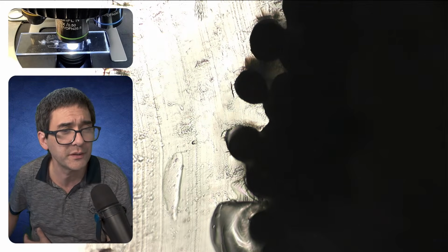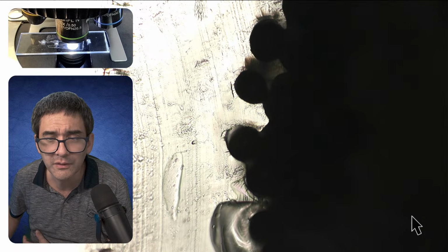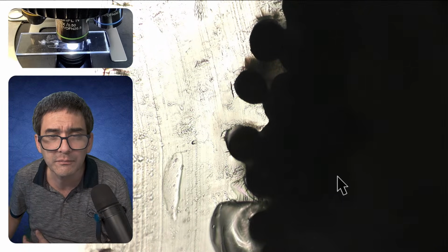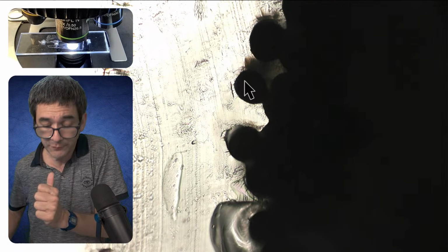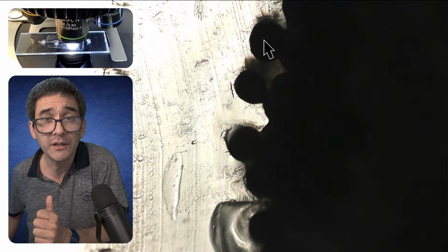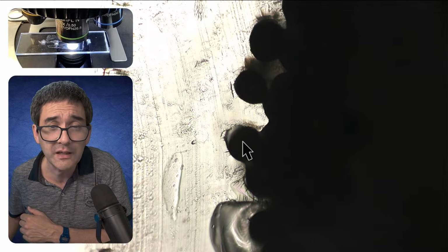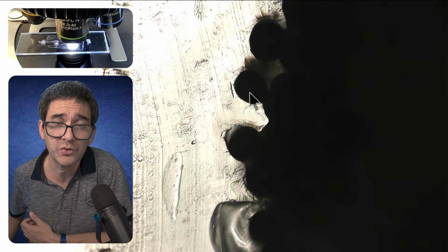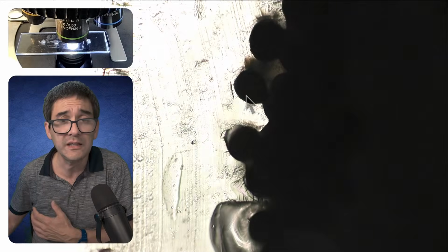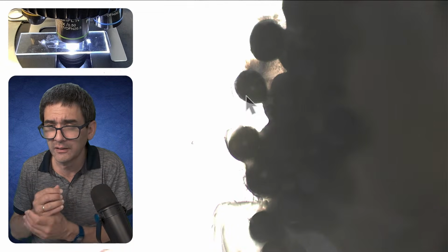So I'm going to turn on the arrow now. My mouse is here. Do you see those round things here? That's basically the hair seen from the top. Here, here, and you see that they're way too dark. I was hoping to see the canal, but it's unfortunately too dark to see that. I'm going to go up with the brightness. That would have been a technique to look at it.